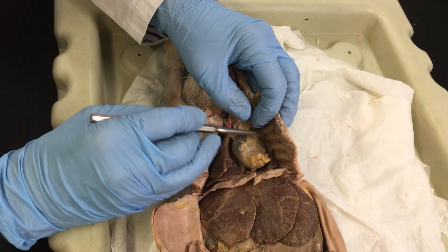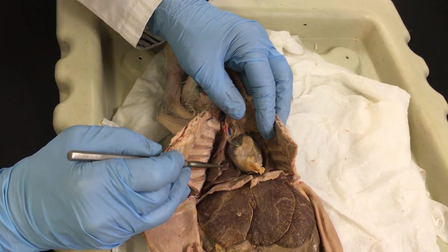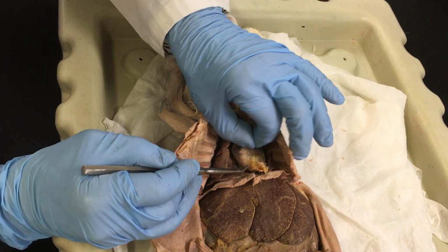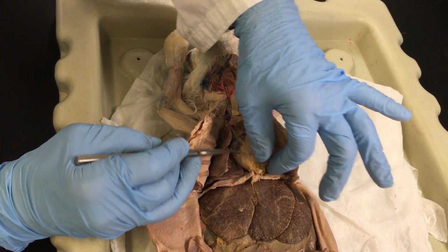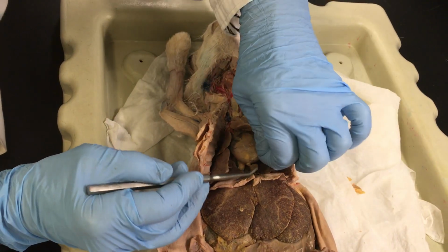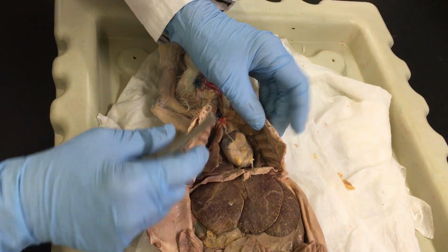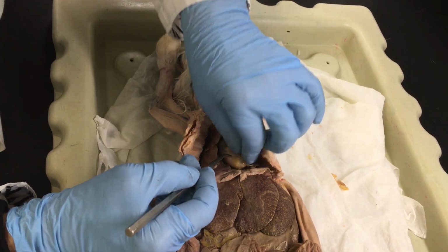If I lift the thymus gland now, as you can see, I can expose the heart. Just like we saw in the shark, it also sits in a cavity called the pericardial cavity, the cavity around the heart. The heart itself is contained in a little sac, which is called the pericardial membrane. In this one particularly, there's a little bit of fat sitting on it, so I'm going to pick it out. If you remember, when the organs are sitting in a cavity, there is a membrane that surrounds the cavity itself. That's the pericardial cavity, or in this case, the sac.